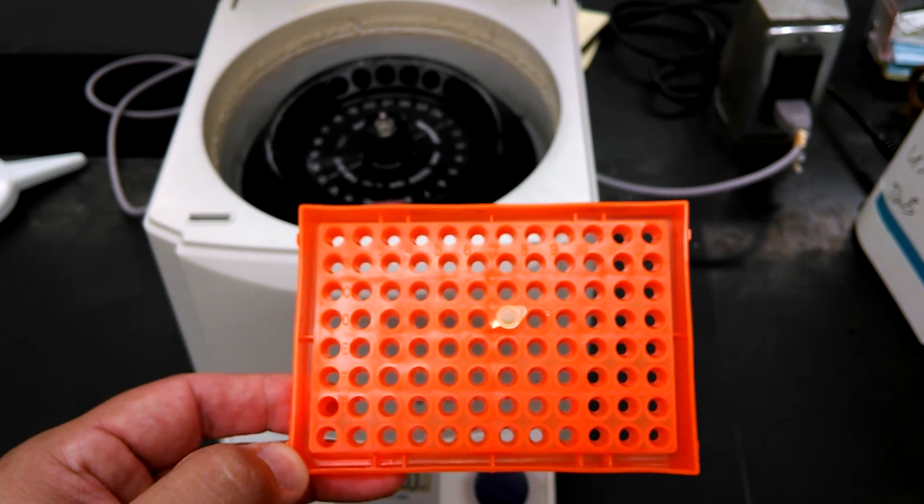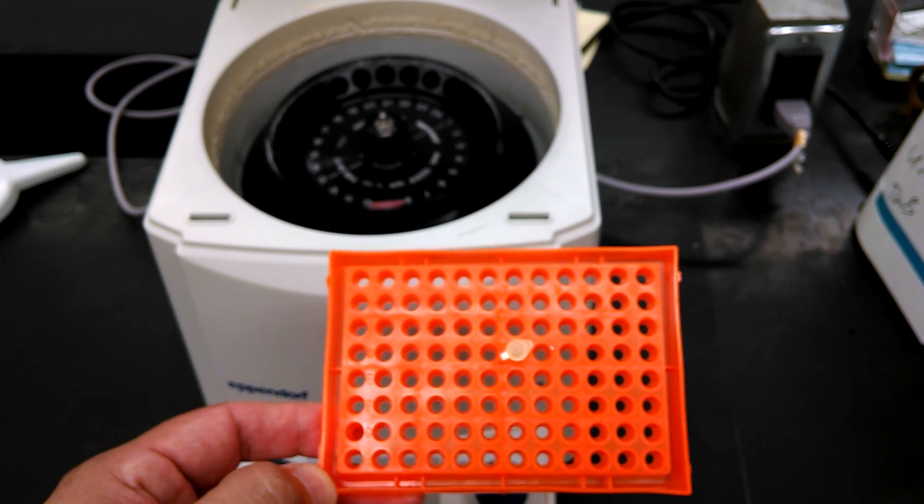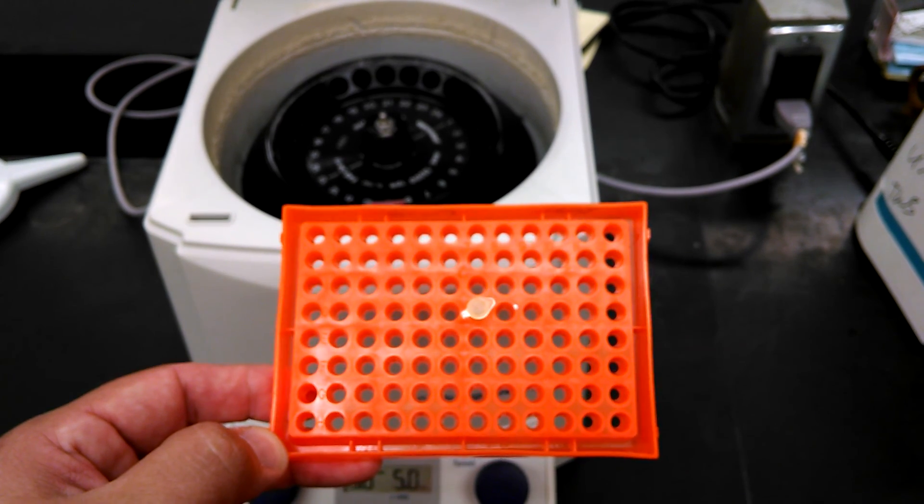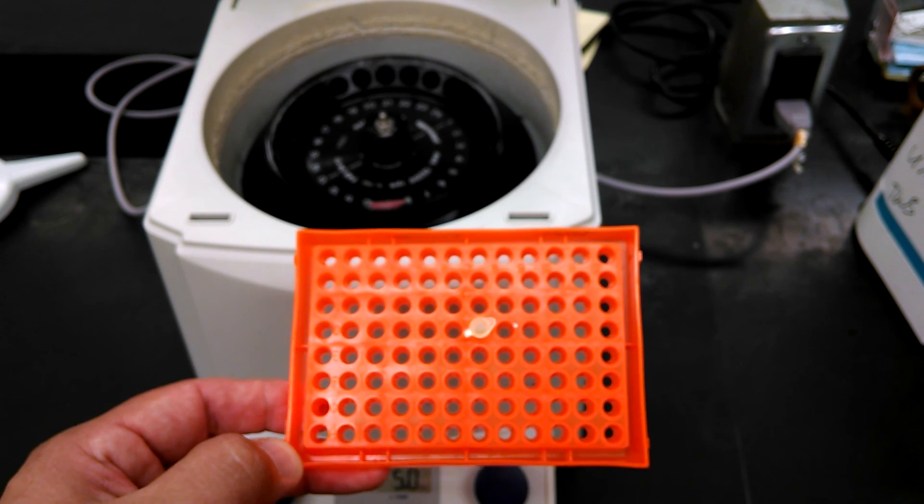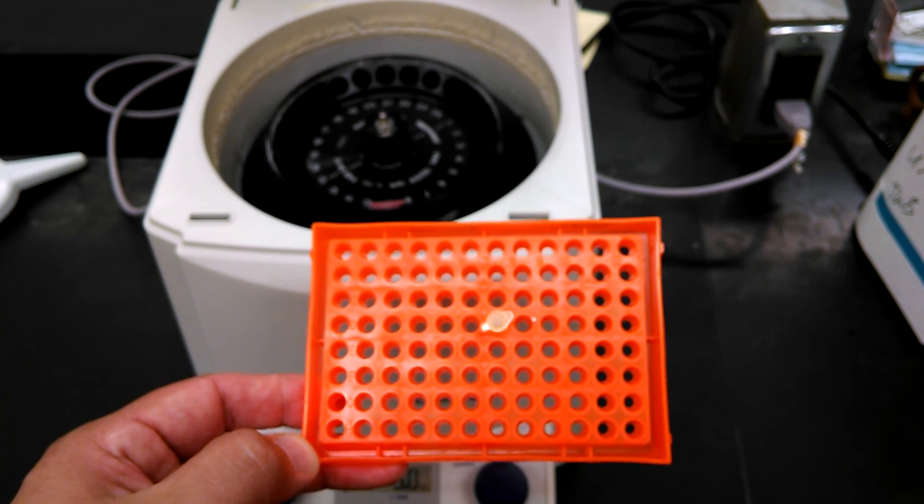Those are the key points. You'll get the full instructions in your lab manual. You'll get a few pointers from your TA. But that is the most critical thing. Don't get an Instagene bead. If you don't do that, your PCR will work.